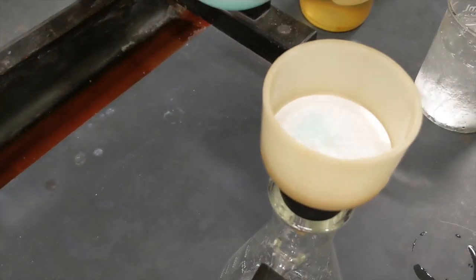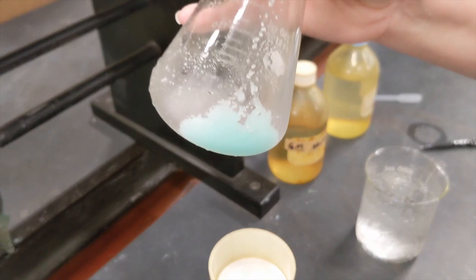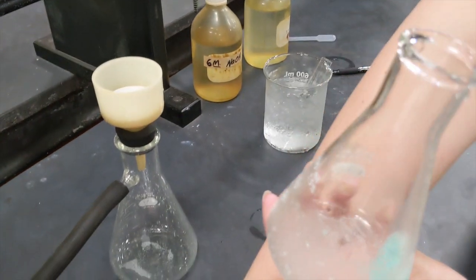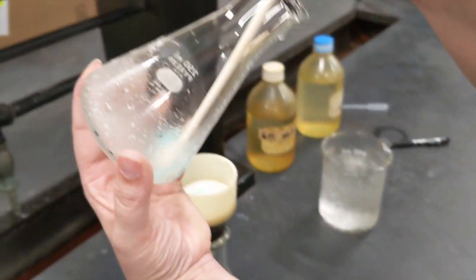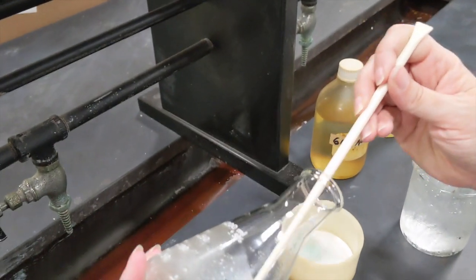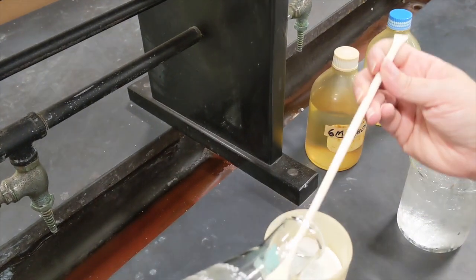Now, not very much solid came out. It's all stuck in the bottom of my flask, so I'm going to use a plastic scoop to scrape this out of here onto my filter paper.